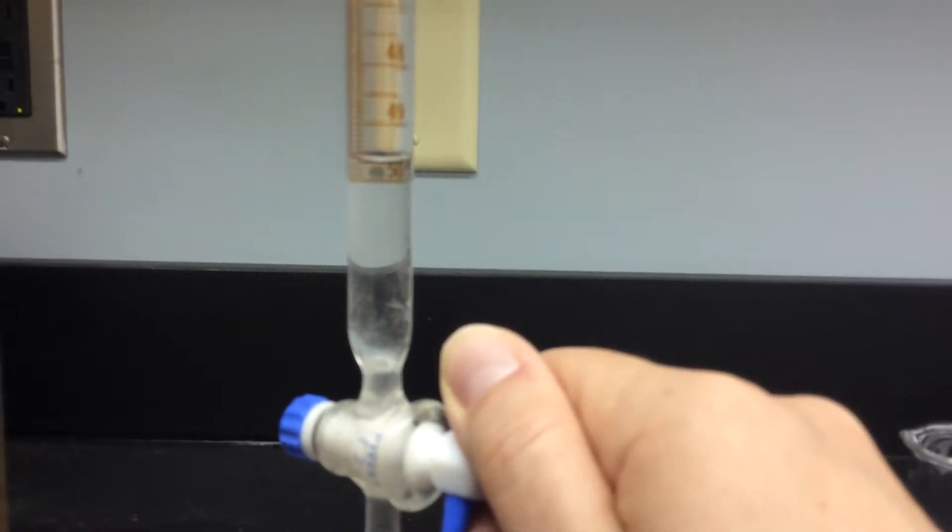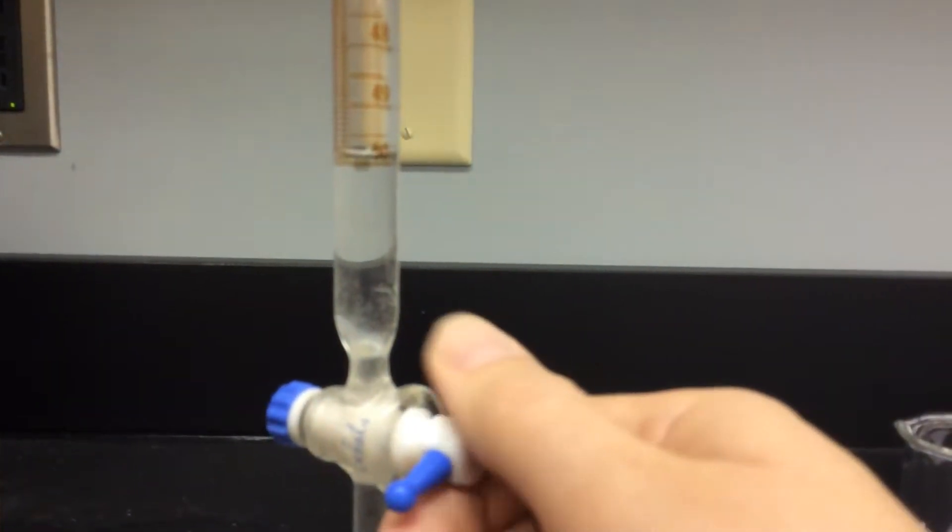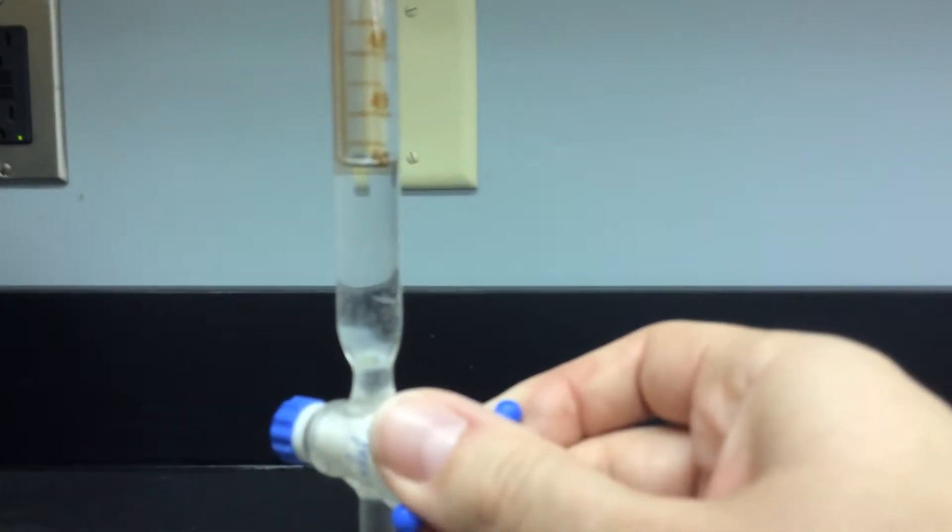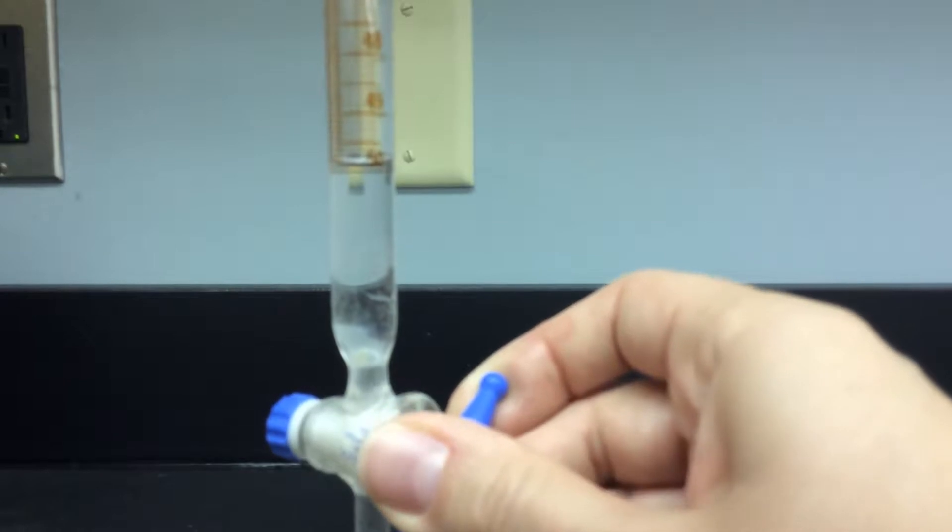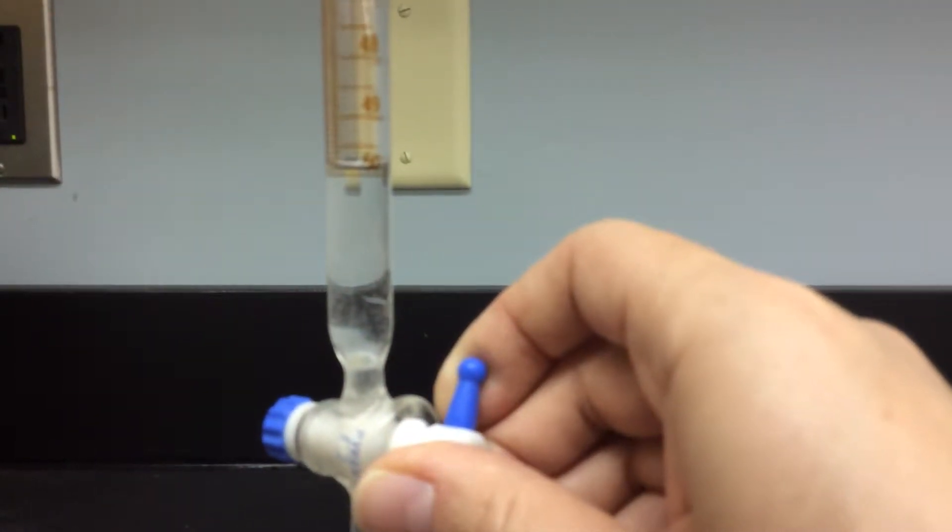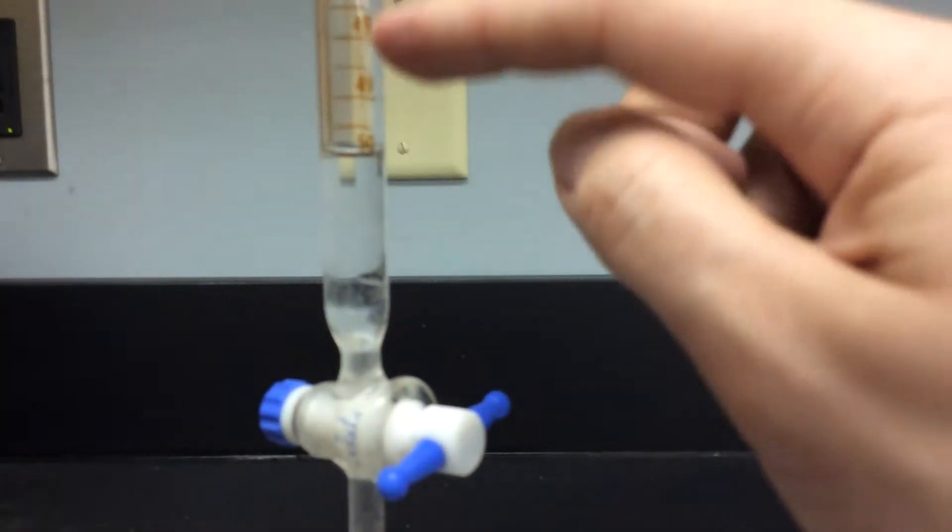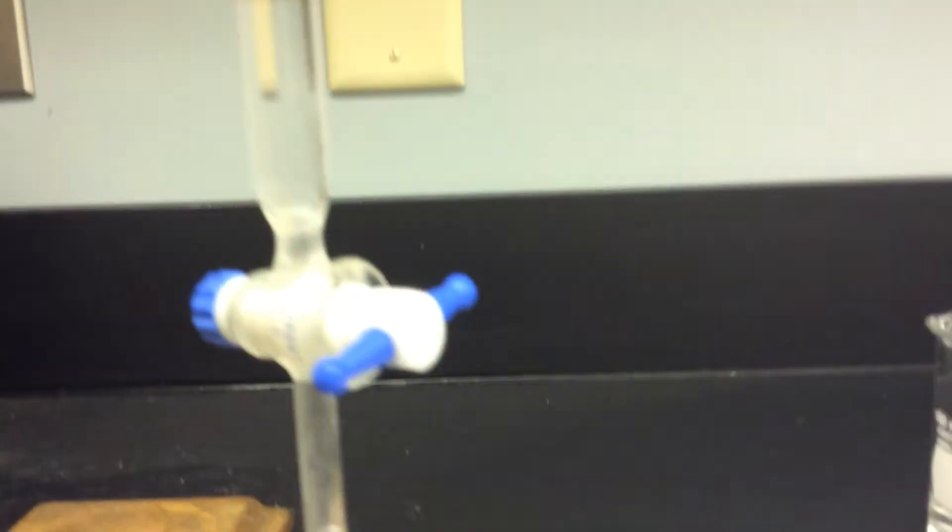There we go. Three, two, one, stop. There we go. Perfect. The meniscus is right on the line.